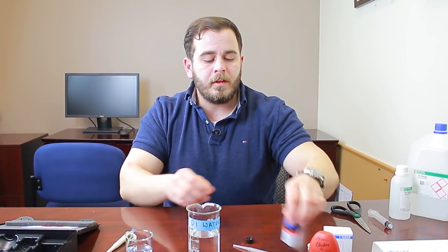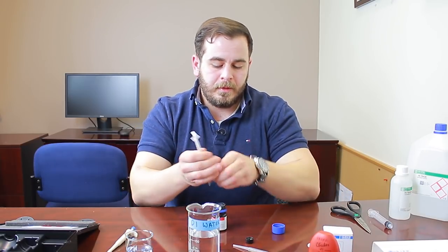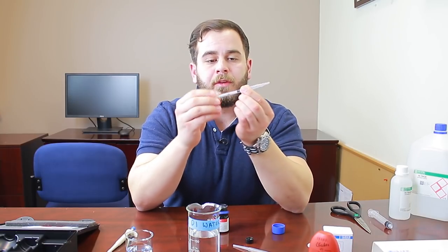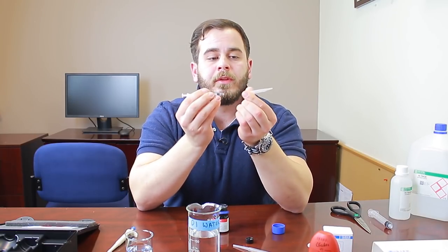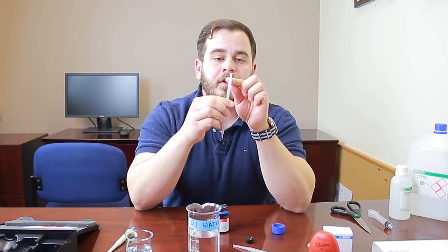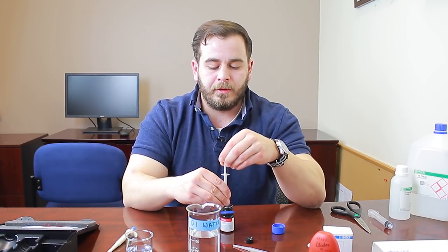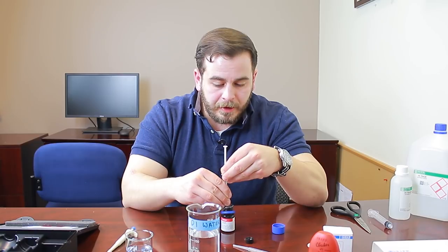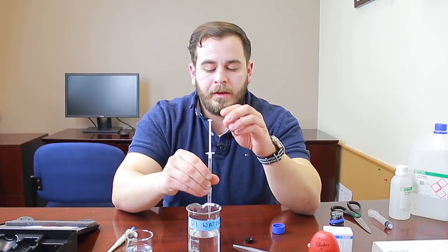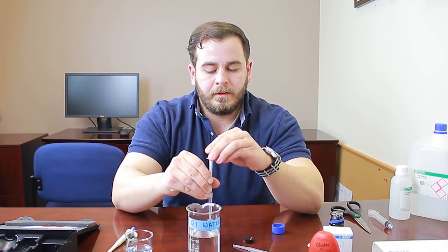To run the test, first open the liquid bottle of reagent A. Attach a tip onto the 1 mL syringe — when you draw up the reagent, all of it will be in the tip with none in the syringe itself, making it easier to ensure you get the right dosage. Draw up exactly 1 mL of reagent A and administer it to your cuvette.